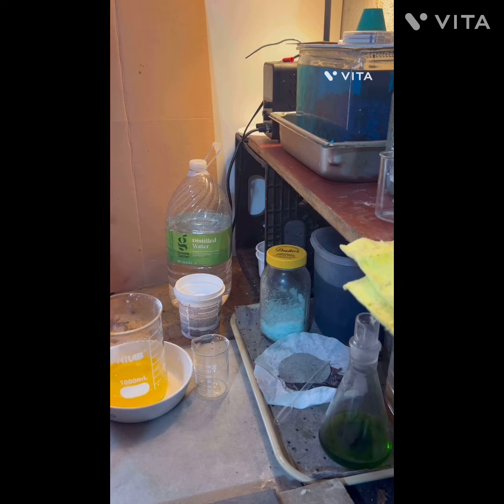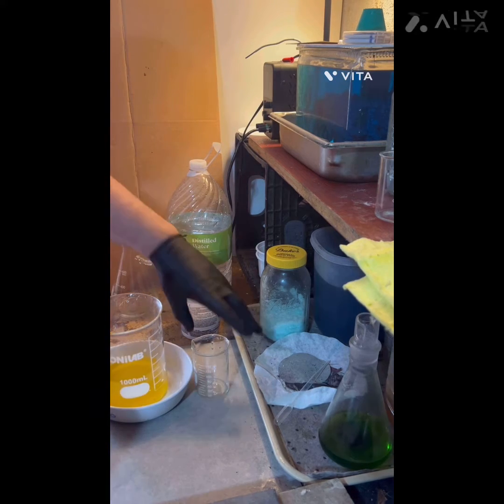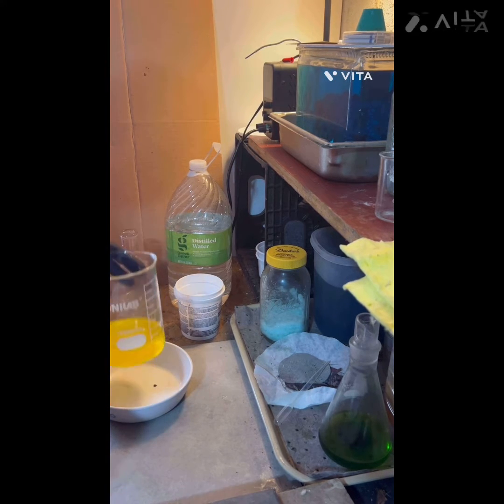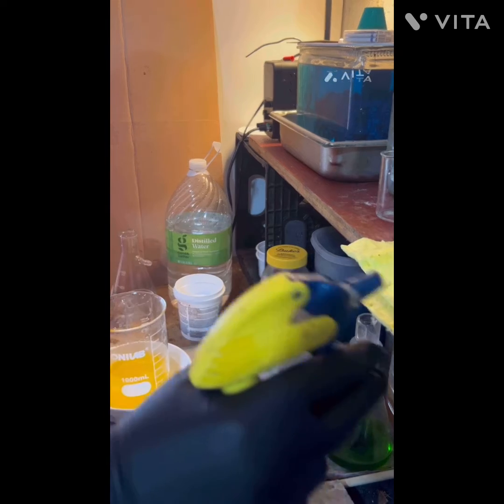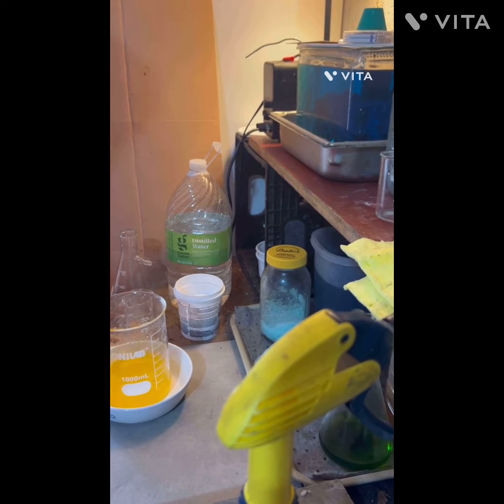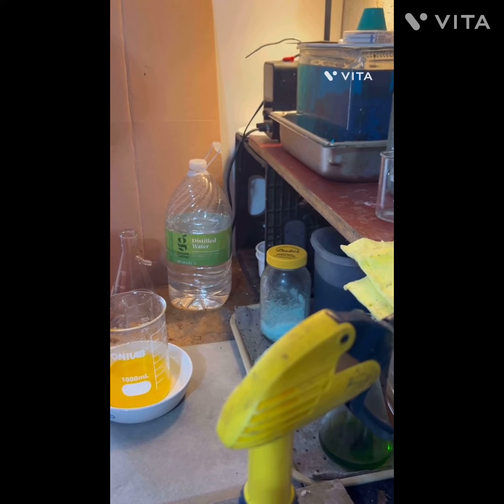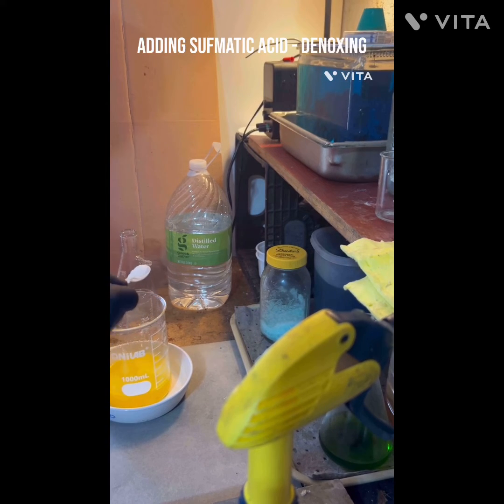We're diluting, we're cleaning out the beaker - note the catch pan here in case we spill any, to collect it. It's been filtered twice and we're going to try and drop today. But I want to get rid of some excess nitric, so we're going to put a little bit of sulfamic acid in it. We got a little bit of a reaction, so we've got a little bit of nitric in there.